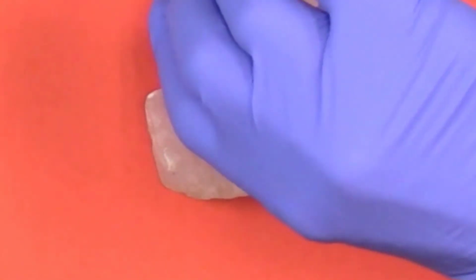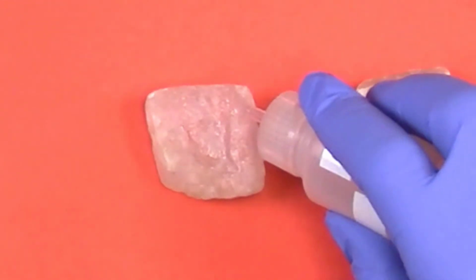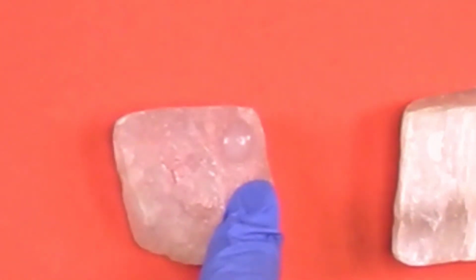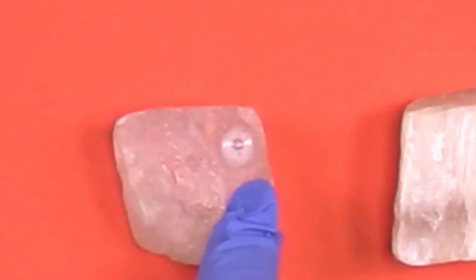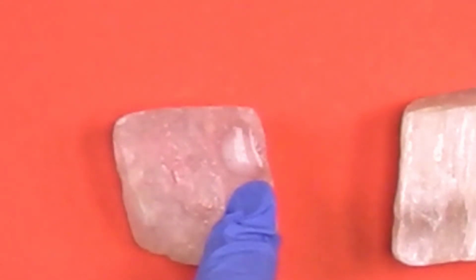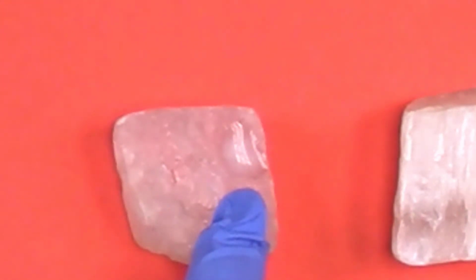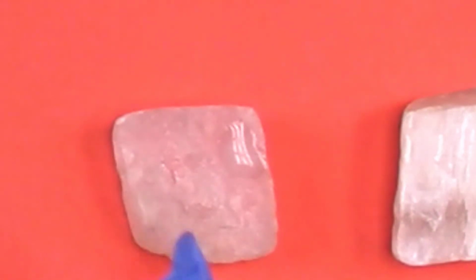And let's try this one. And hopefully you can see here that there's a strong reaction. What's happening is the mineral is partially being dissolved and carbon dioxide gas is being released. And as the gas moves up through the acidic water, it's producing bubbles and it's changing the chemistry of the water.